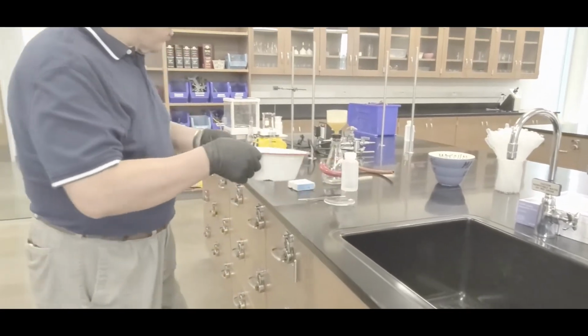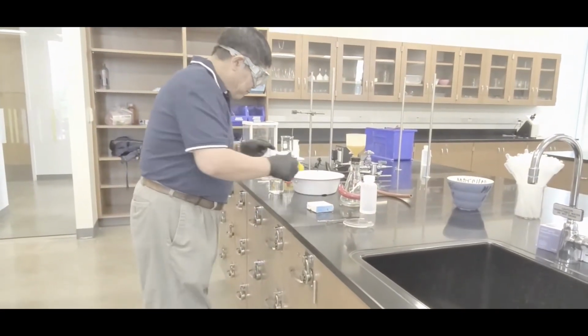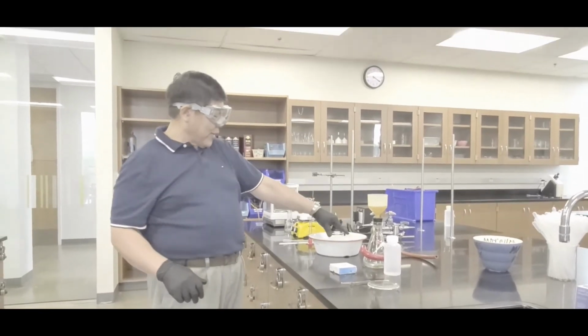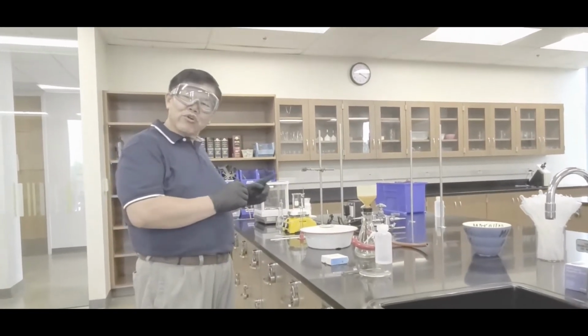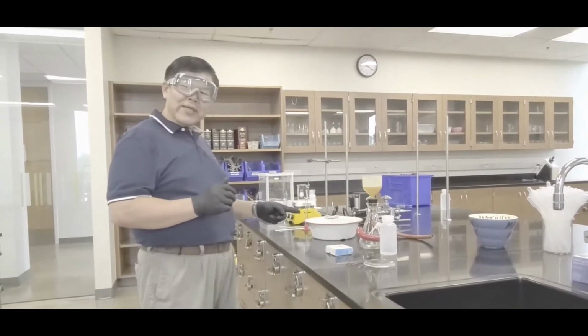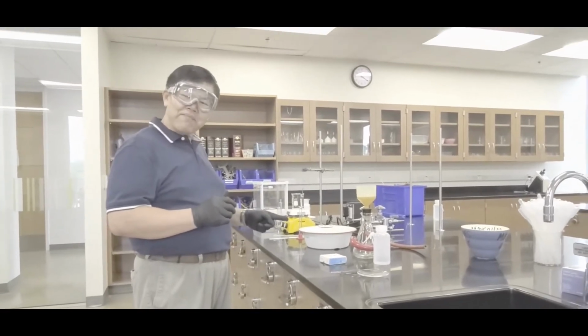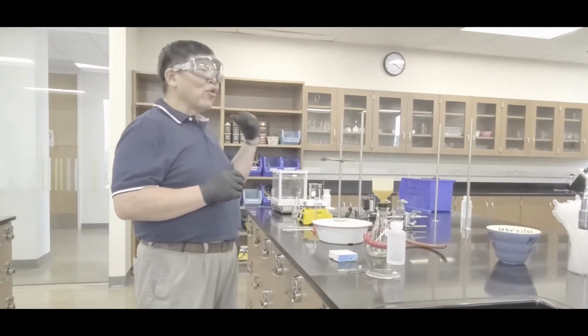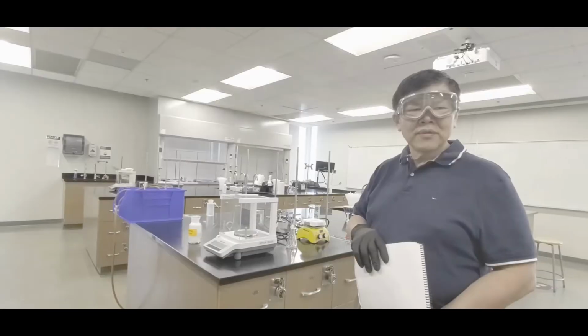Okay? And then what you do is park that 250 milliliter distilled water in there. Okay? You want to chill that, so this will take the longest. That's why I'm doing that one first. Okay? So I'm going to go weigh the thing out in just a bit.